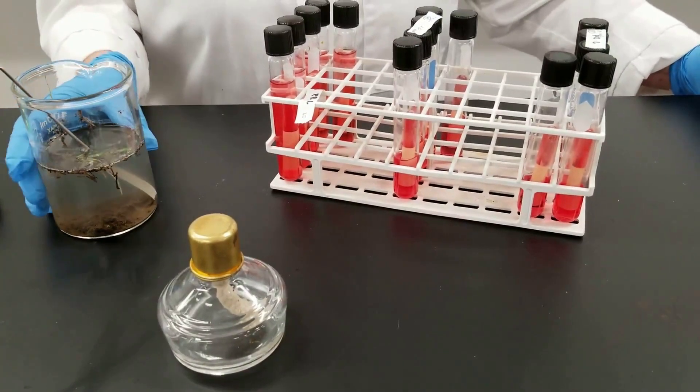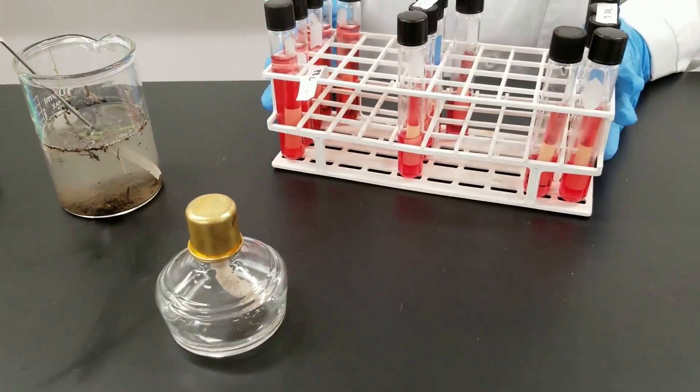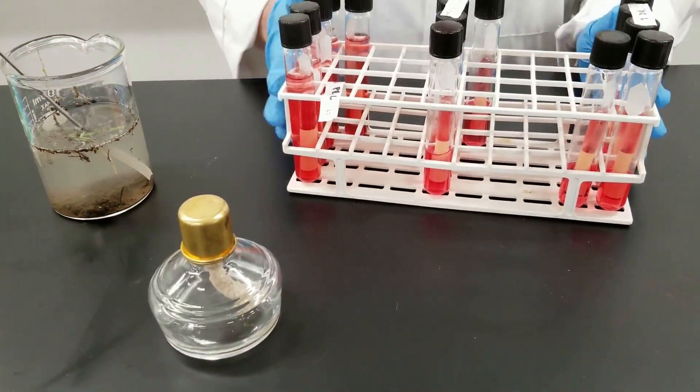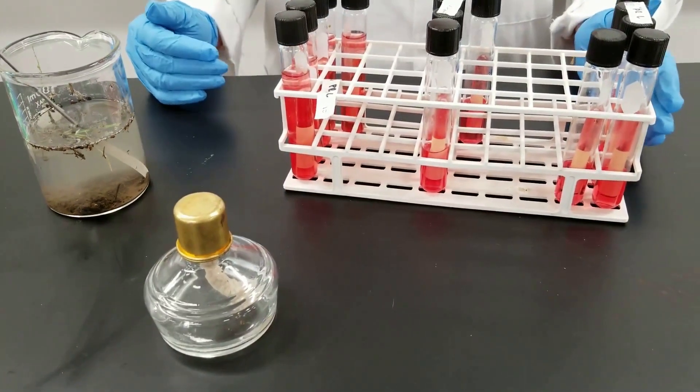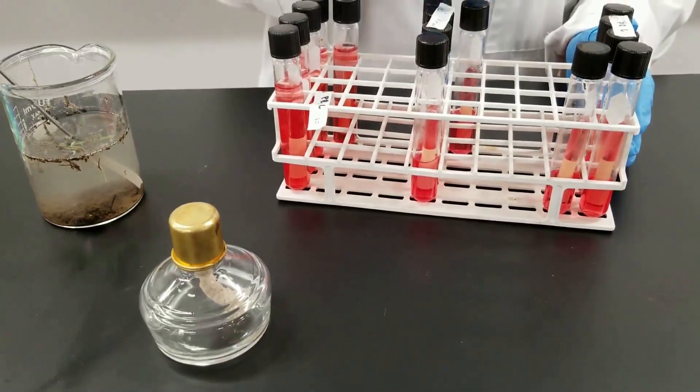So we have a water sample that we obtained. Now, I have already inoculated these tubes. They have phenol red in them as an indicator, has lactose, and they're at different strengths.